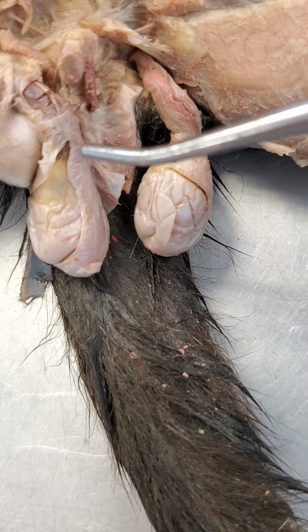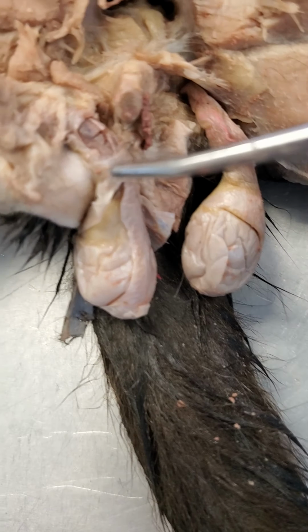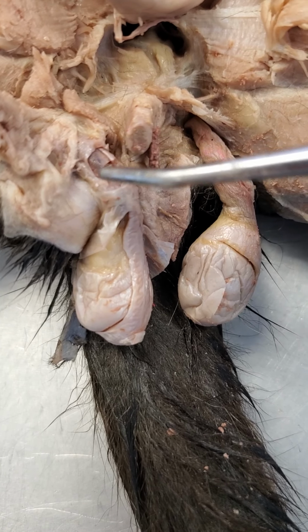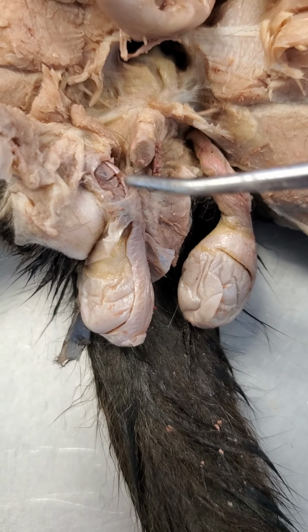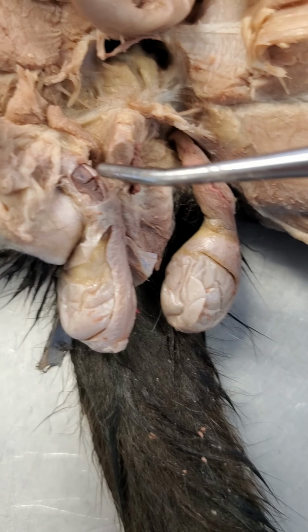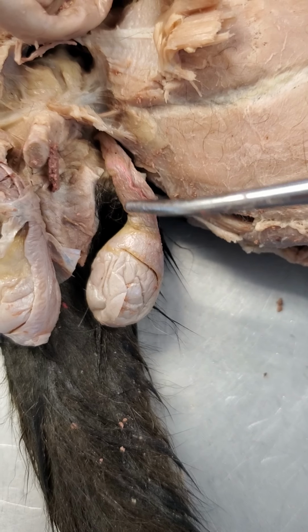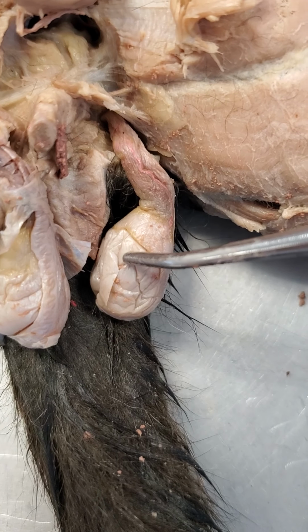And at the end of the epididymis, it leaves through the vas deferens. And you can see right here that it's starting to leave through this kind of tubule-like structure. This is actually called the spermatic cord. So that spermatic cord is going in towards the abdominal cavity. And inside the spermatic cord, of course, is this vas deferens, but also the spermatic artery, the spermatic vein, and some nerves.